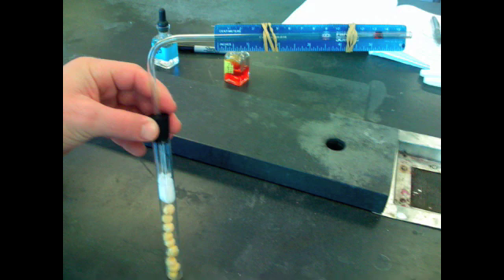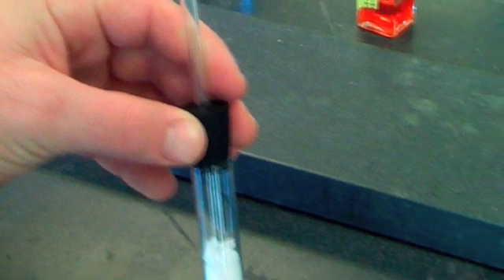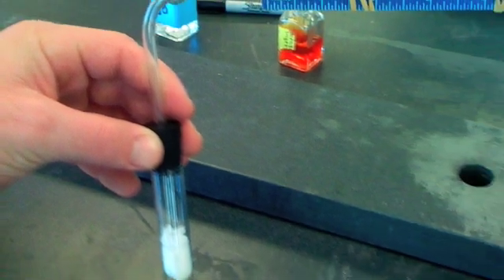Yeah. Then we added respirometers to the top of the test tubes and put phenol red inside them to use as an indicator. Then I remember we made two more identical test tubes, but this time without the KOH. That way we could measure the CO2 production as well.